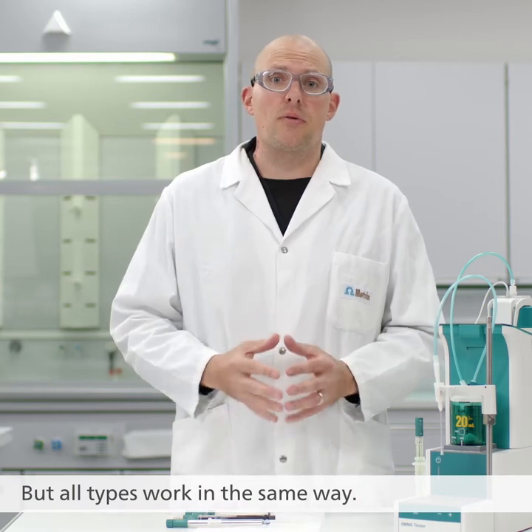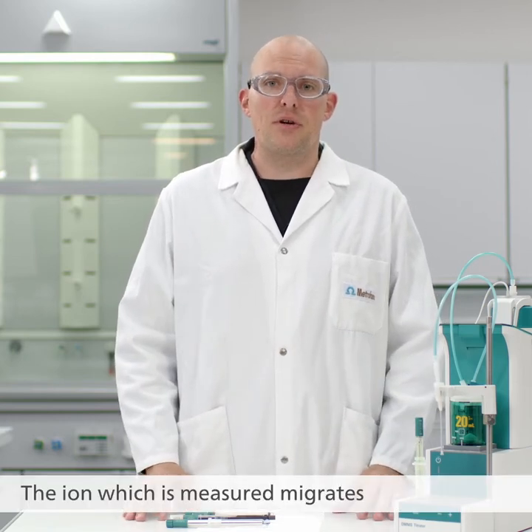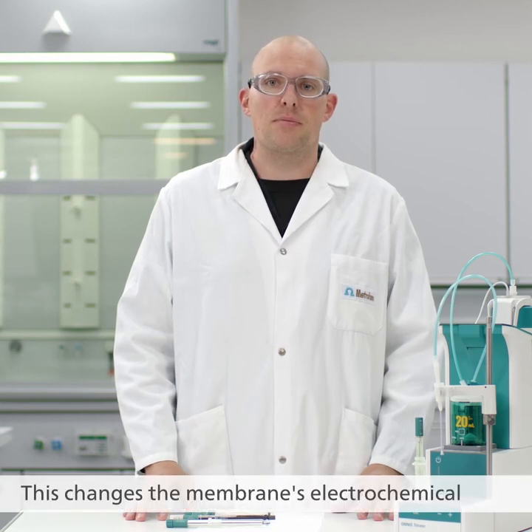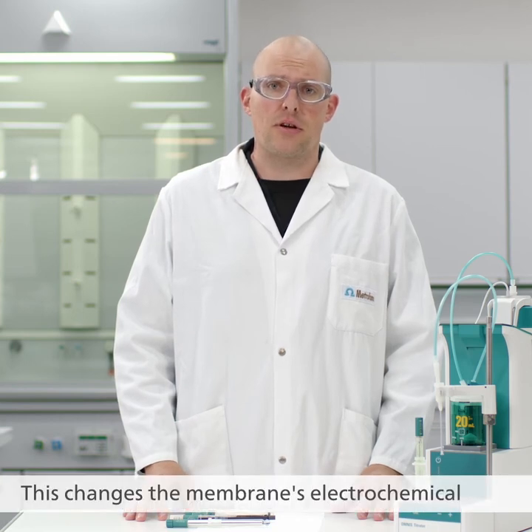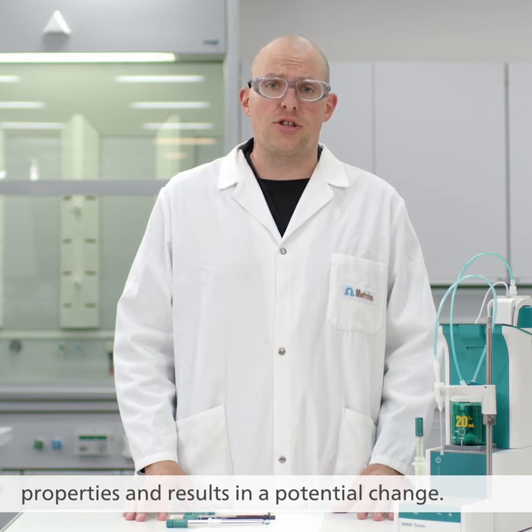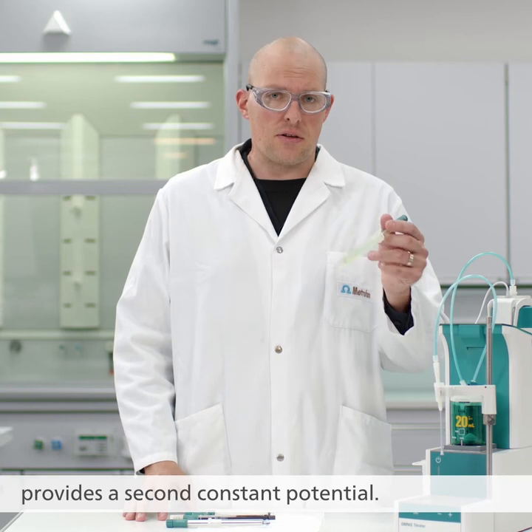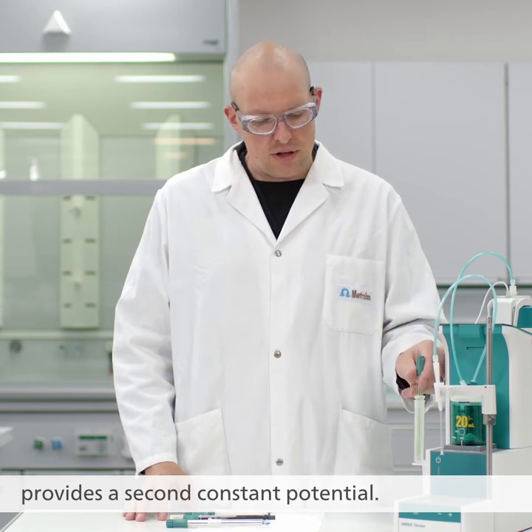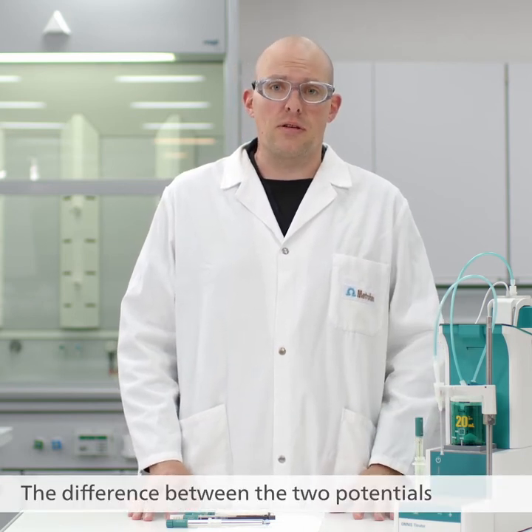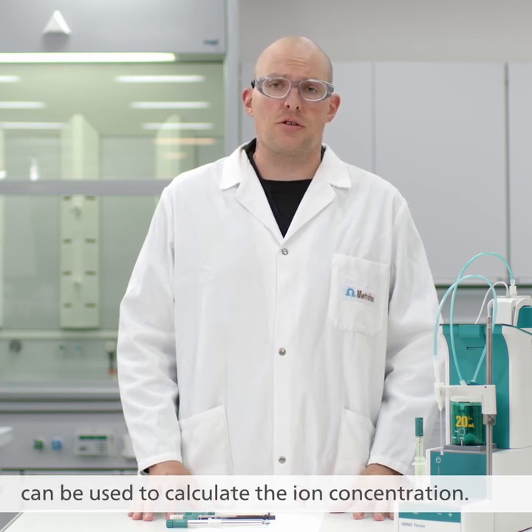But all types work in the same way. The ion which is measured migrates into the electrode's membrane. This changes the membrane's electrochemical properties and results in a potential change. Meanwhile, the reference electrode provides a second constant potential. The difference between the two potentials can be used to calculate the ion concentration.